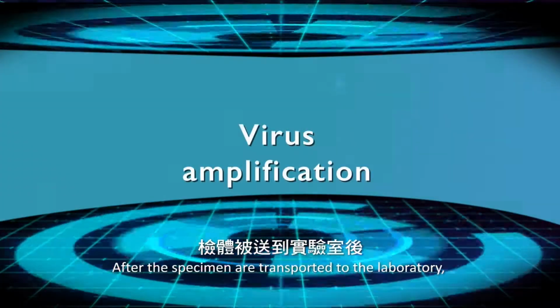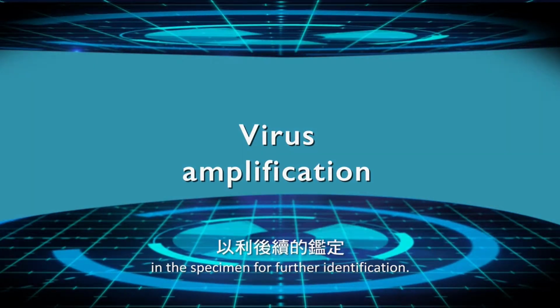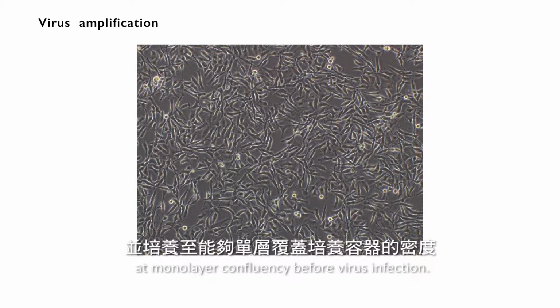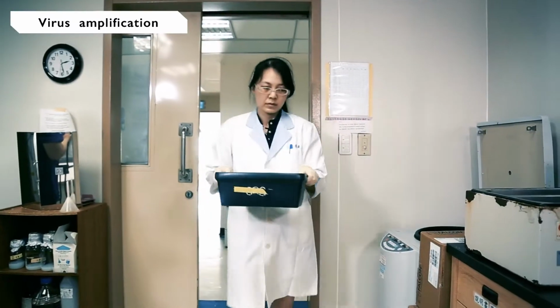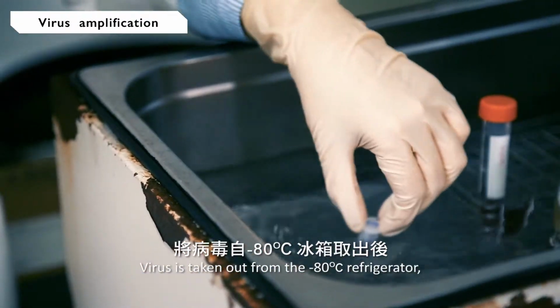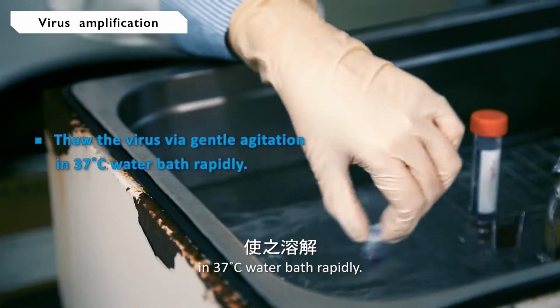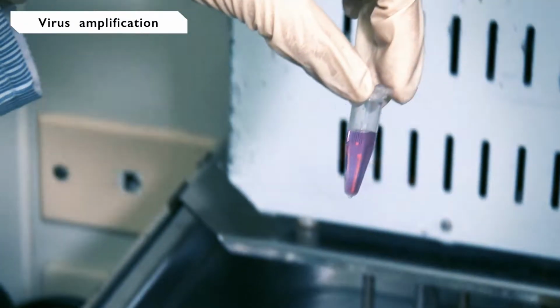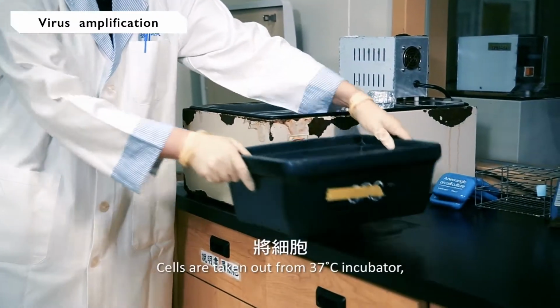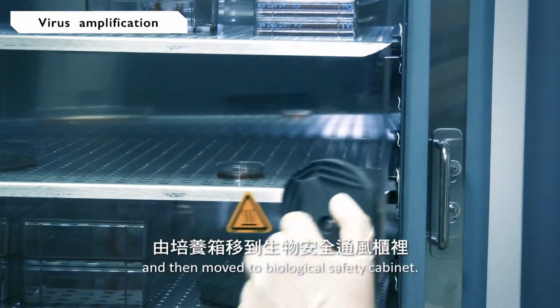After the specimens are transported to the laboratory, we will amplify the virus in the specimen for further identification. First step, cells are seeded to monolayer confluency before virus infection. The virus is taken out from the minus 80 degrees Celsius freezer and thawed via gentle agitation in a 37 degrees Celsius water bath rapidly. After the ice crystals melt, place the virus on ice. Cells are taken out from the 37 degrees Celsius incubator and then moved to the biological safety cabinet.